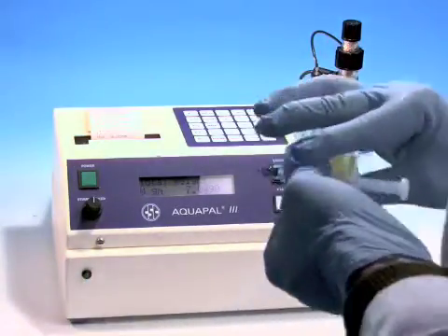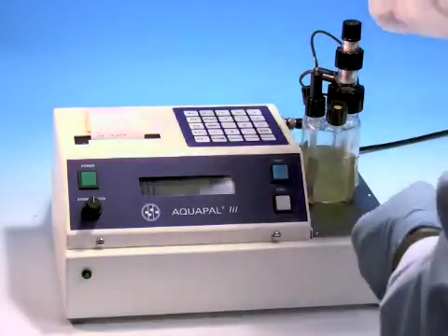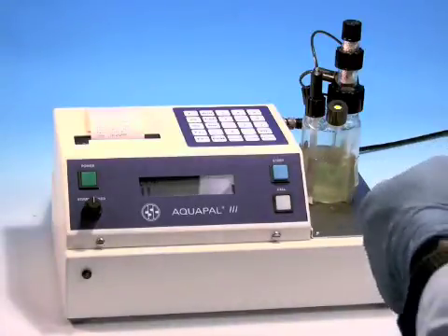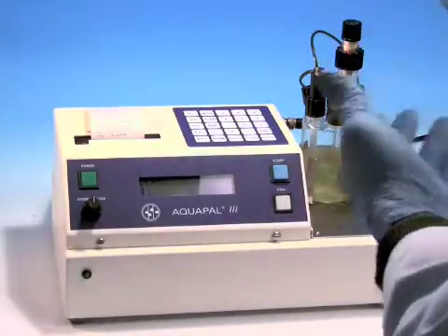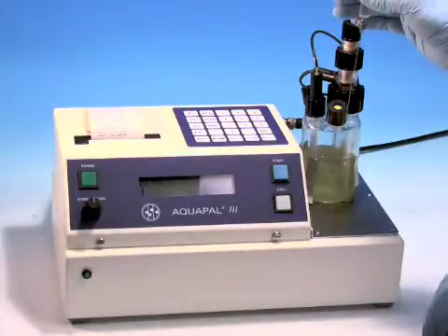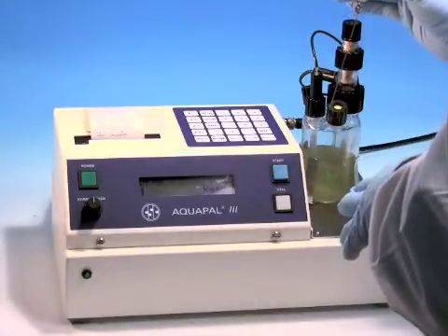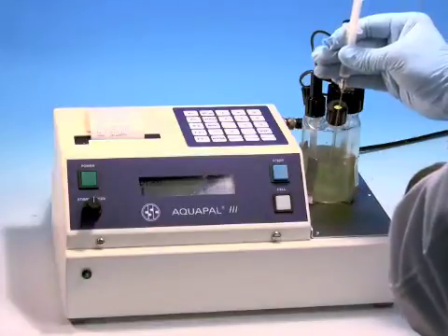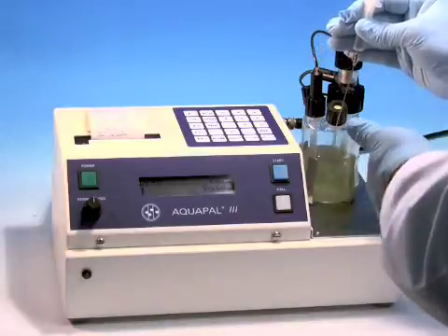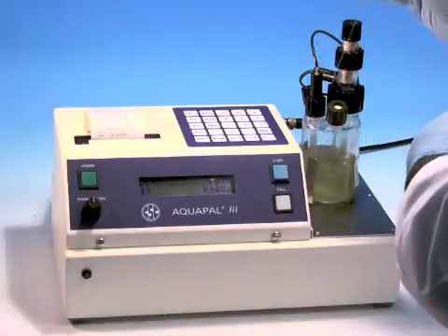We're going to enter the weight 7.0490, hit enter, and now it's going to prompt me. It's going through a precondition but now it's ready. Now what I'm going to do is inject the sample and press the start button. The idea is to get the needle underneath the liquid level and hit the start button so that you're measuring all the water in the sample.